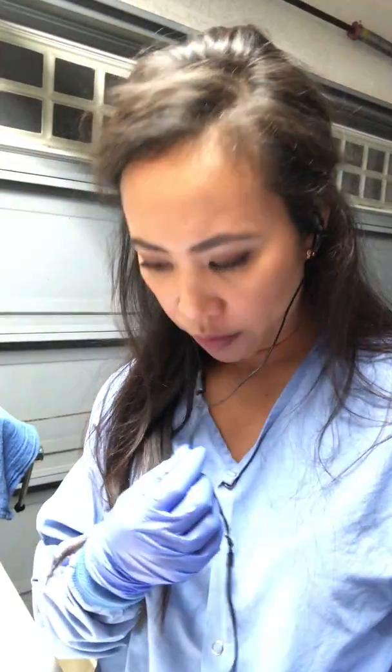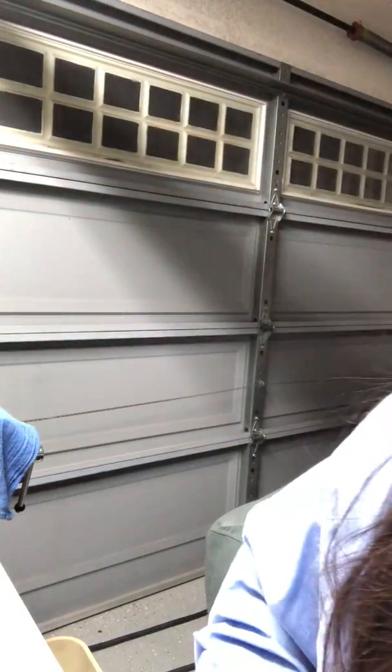Hello, Jocelyn McCarthy here, Biology 225, and tonight I'm going to talk about the biochemical testing for microbial identification using different types of media. And we have the list here. It says Methyl Red, Voges-Proskauer, and catalase testing. Just reading off this.